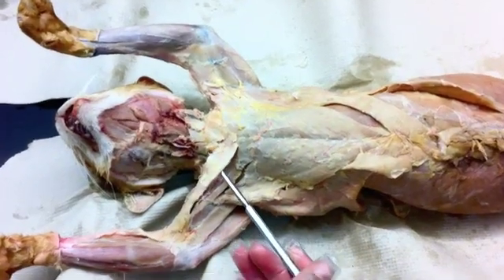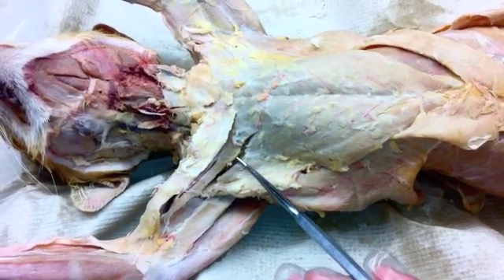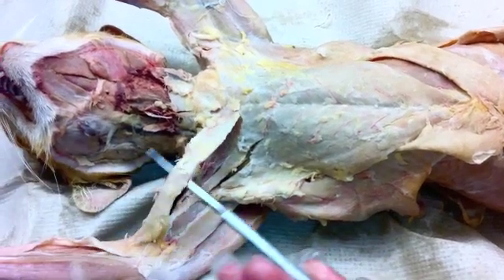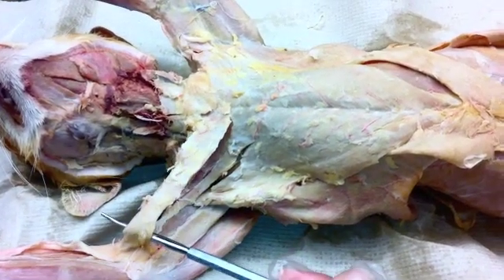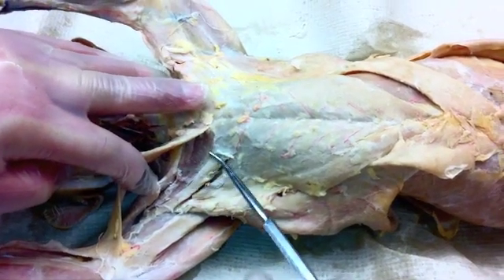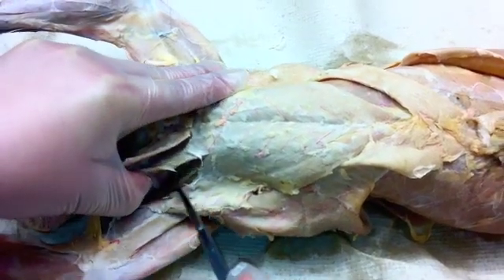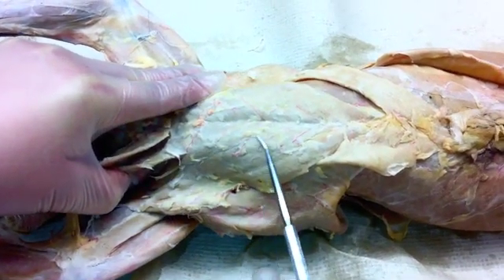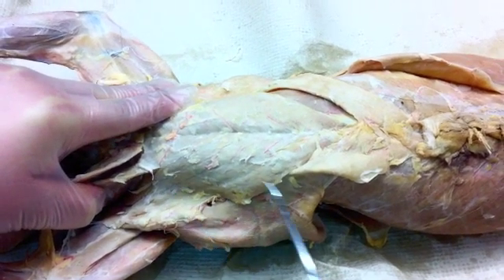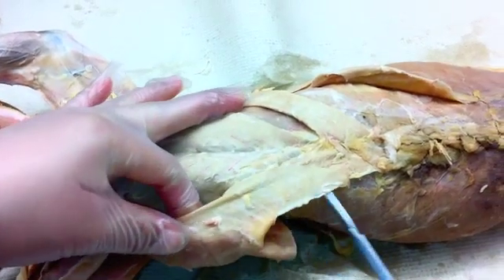Now we have the cat chest muscles. The very first one is the pecto antebrachialis — very long, running from the chest down to the antebrachium. Moving that slightly to the side, we can see the pectoralis major lying underneath. Pulling up on its caudal border, we can see the pectoralis minor underneath, running all the way back to where the xiphihumeralis is found.